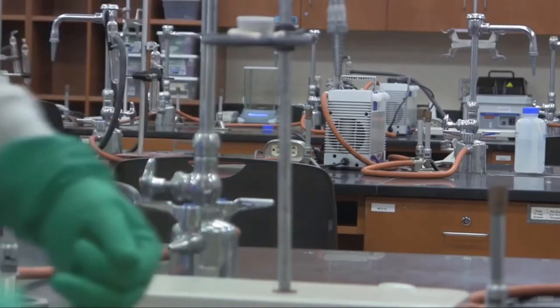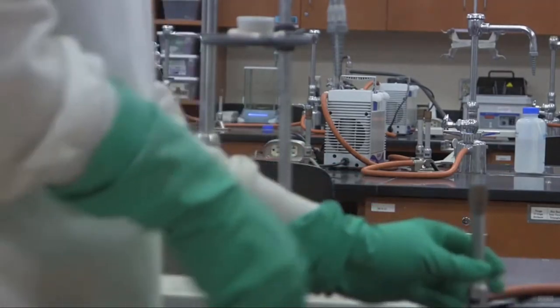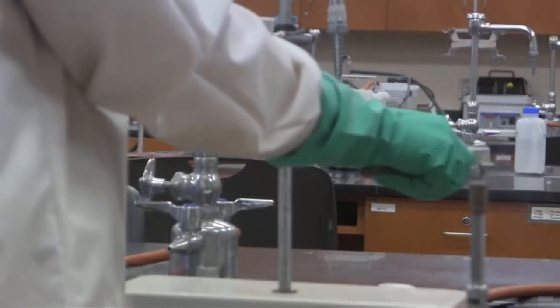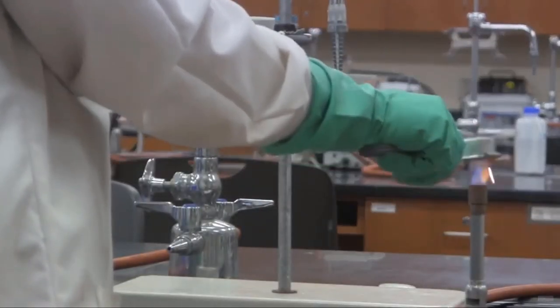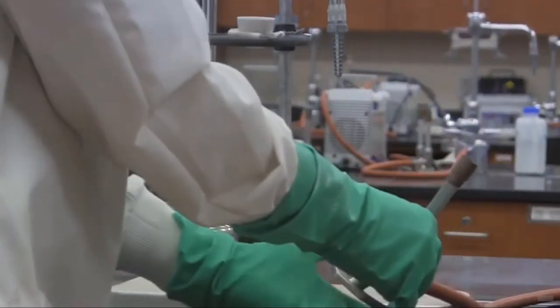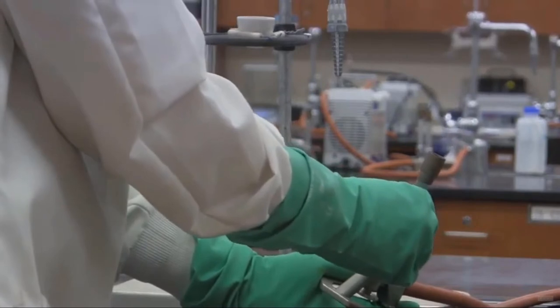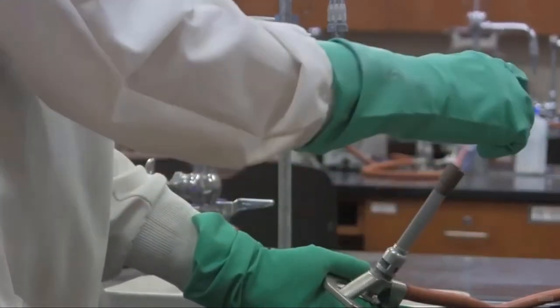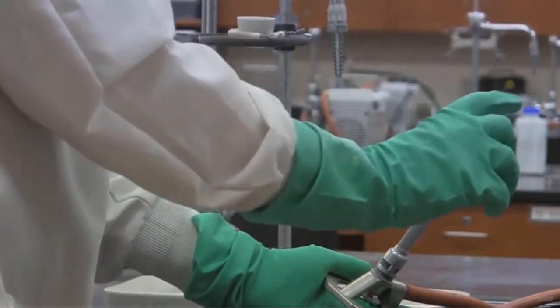To get the water away from it, so we're going to use a Bunsen burner. I'll light the Bunsen burner first. And the kind of flame we're looking for is a blue flame. And this one's not too bad. It looks to be about four to five centimeters high. So about this high. It's about two inches.